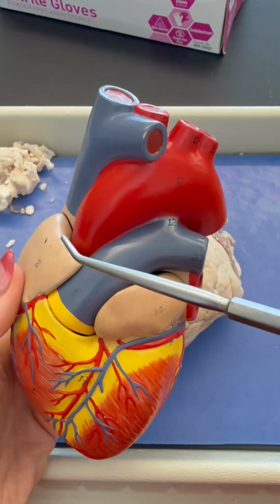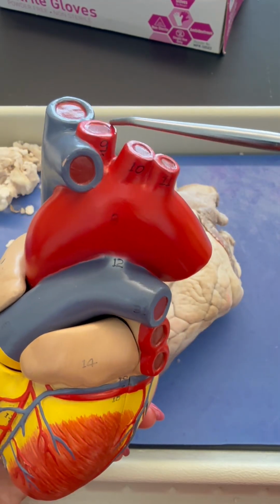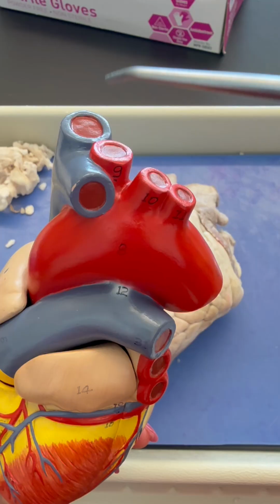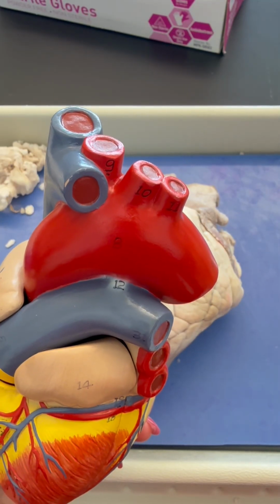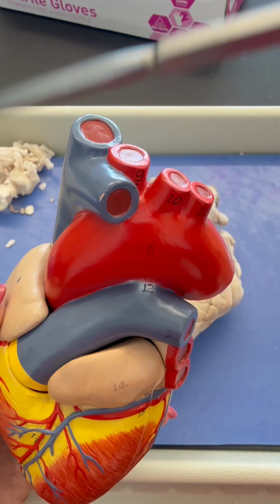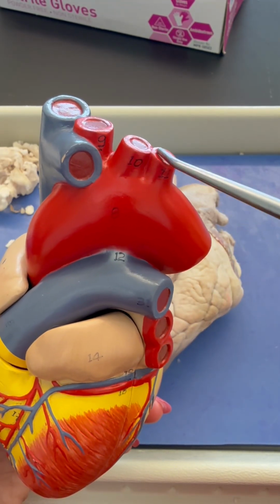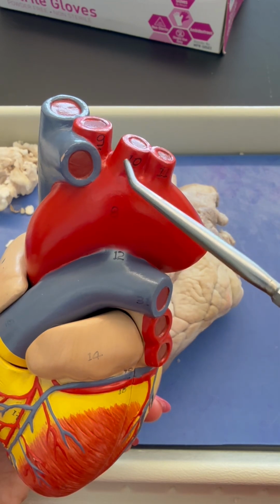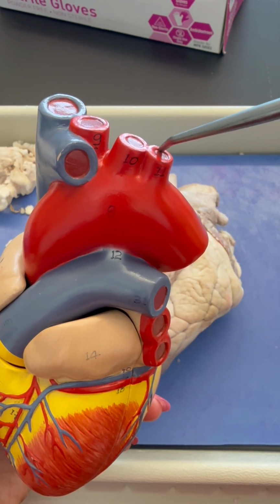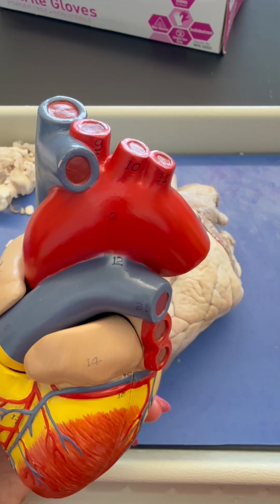We have here the aortic arch, and on humans we have these three branches. Number 9 pointing to the brachiocephalic blood vessel, which then eventually splits into two. We have the right common carotid giving blood to the brain, and the right subclavian bringing blood to the right arm. And then 10 and 11 are already broken into their two branches. So 10 is the left common carotid going through the neck to the head, and the 11 here is the left subclavian bringing blood to the arm.